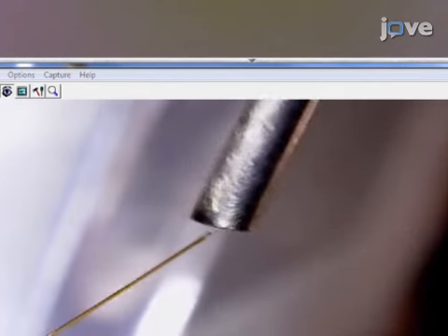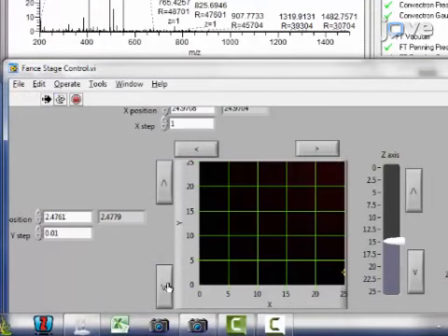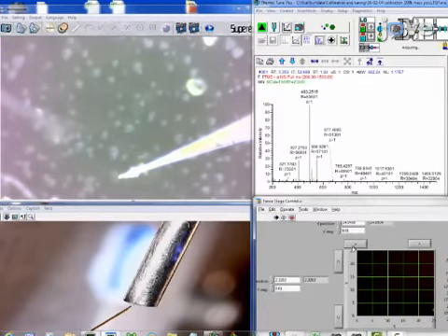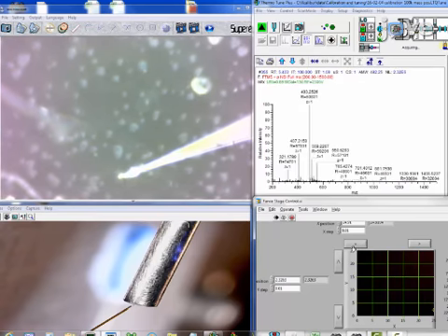Use the USB digital microscope on the side of the single probe to monitor the working conditions of the nano ESI emitter on the single probe. Use the motorized XYZ stage control program and digital stereo microscope to locate a cell of interest and precisely position the single probe tip above the sample.